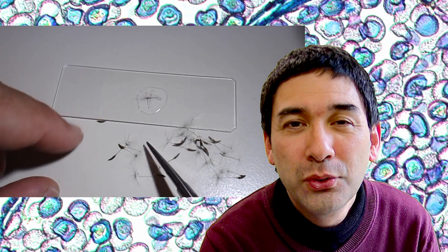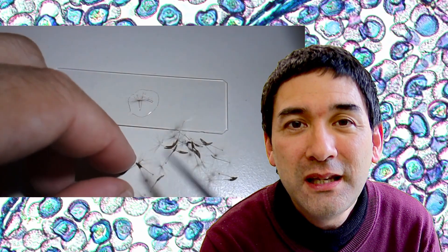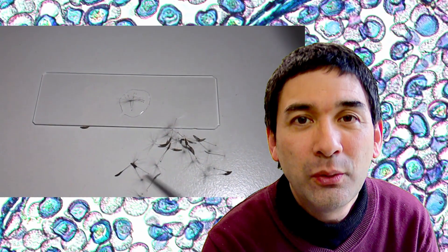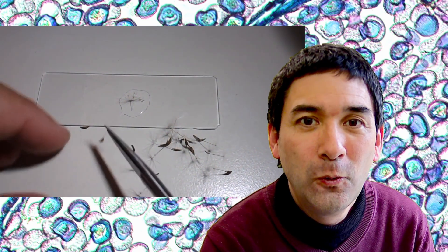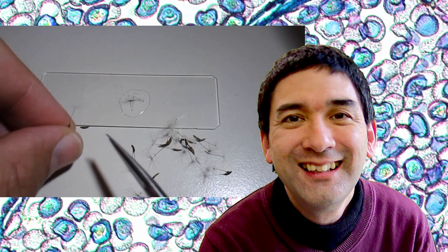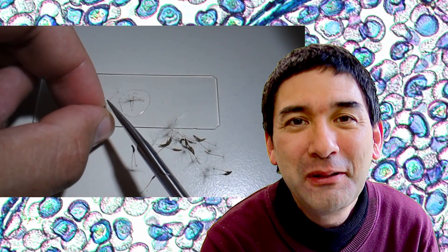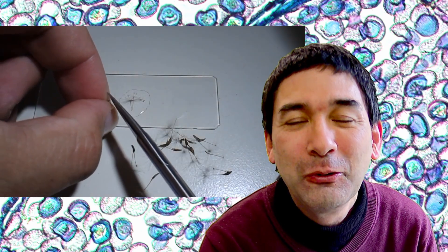I pushed the specimen into the drop of water here. I think I have to add a cover glass now. Am I doing that? No, I'm picking up the next one. This video is indeed very long to watch.